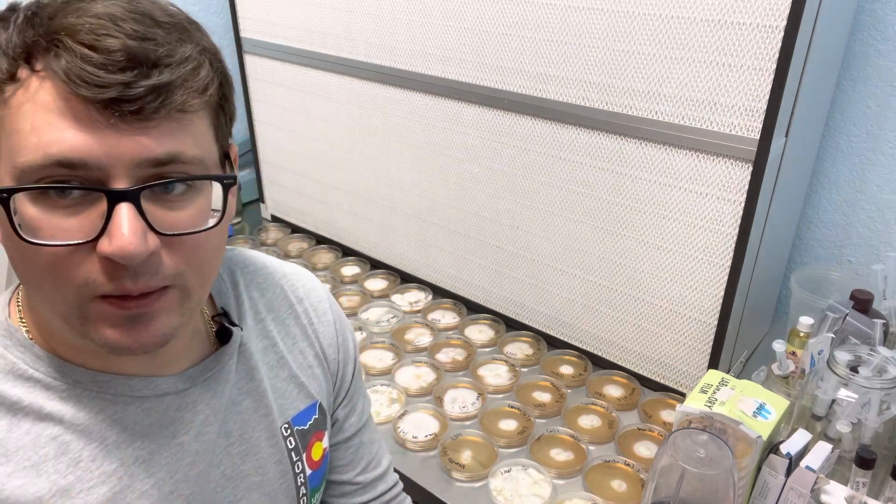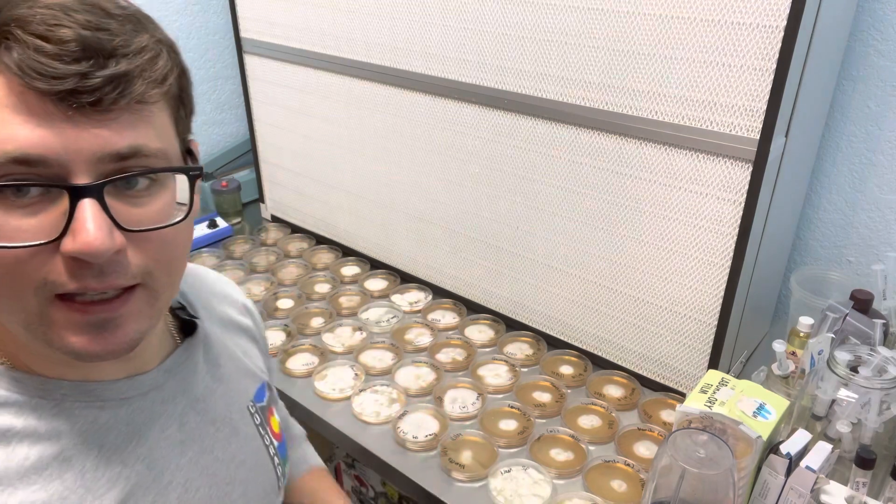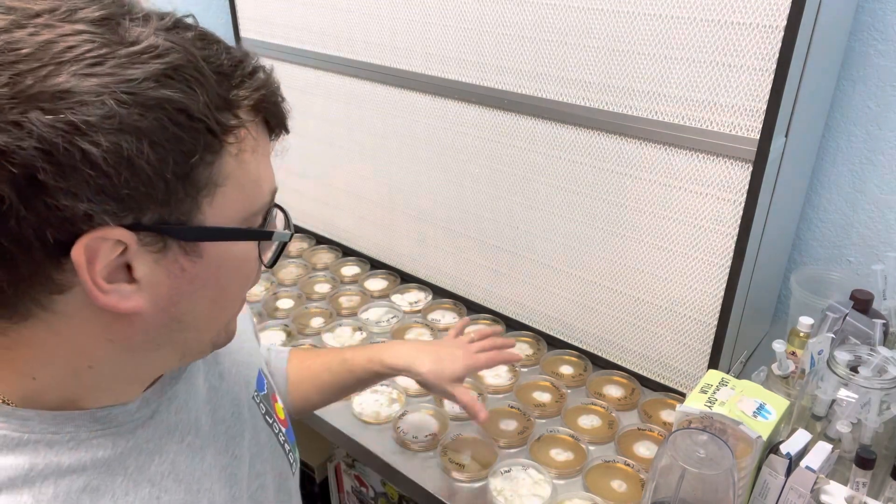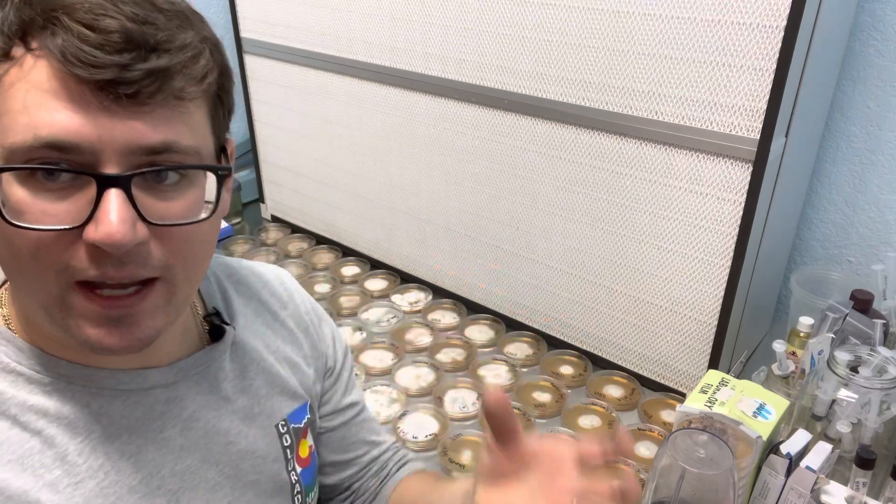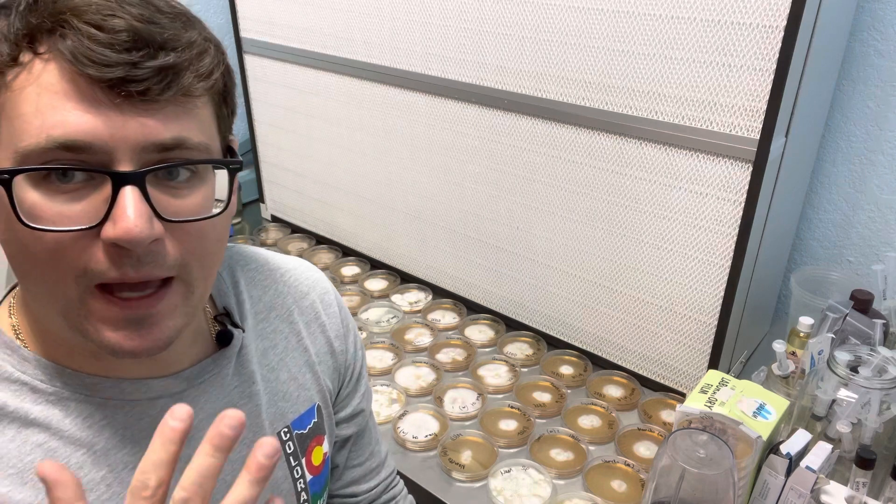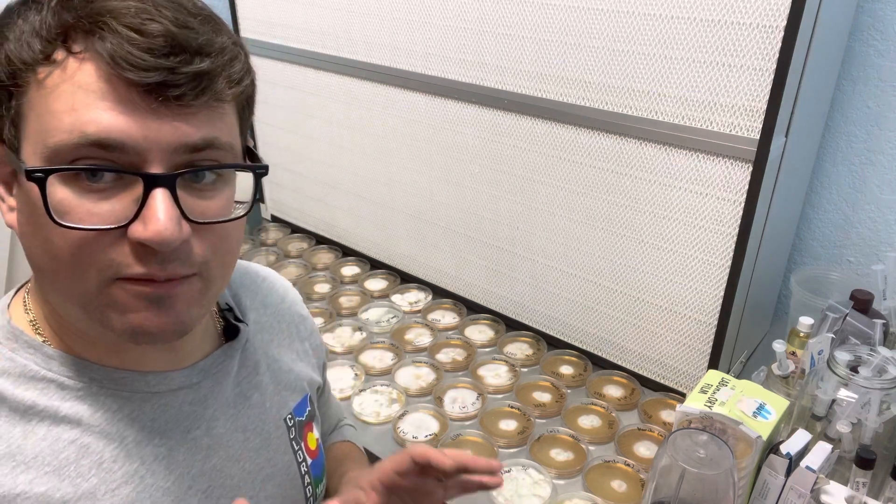Before I do that, I like to let them come to equilibrium so that there's not water dripping onto the surface. When I transfer to the slants, I know they have a better chance of being sterile.